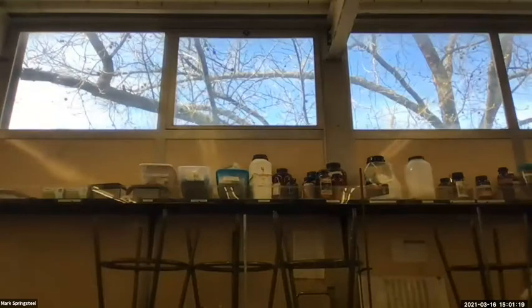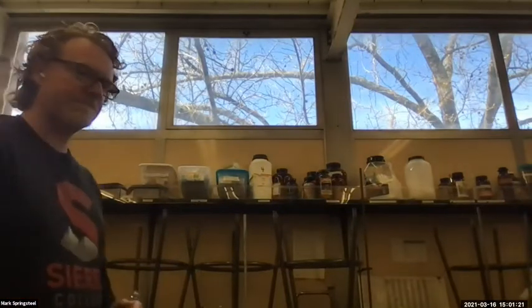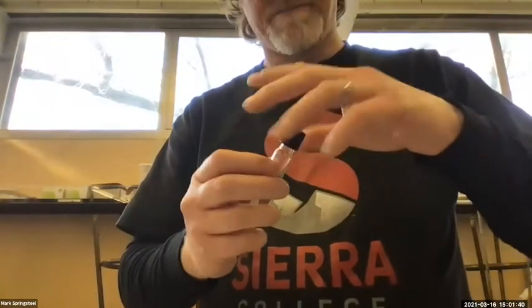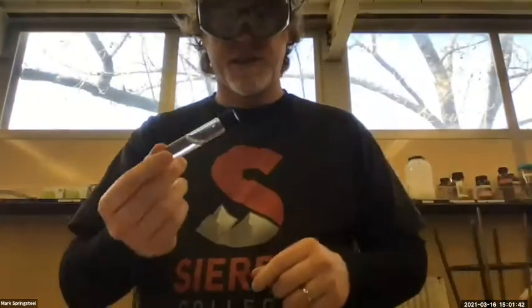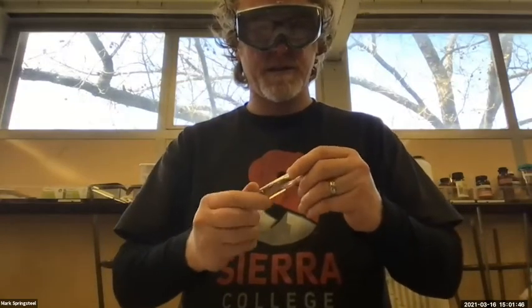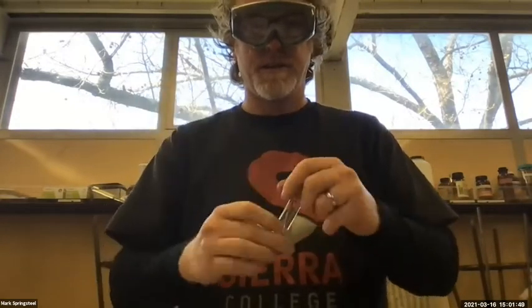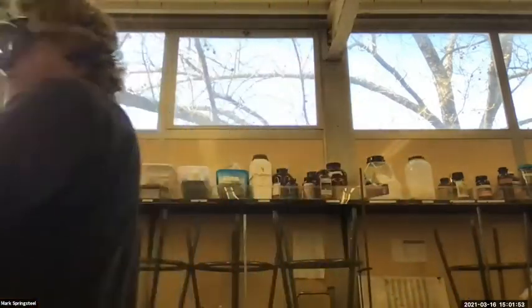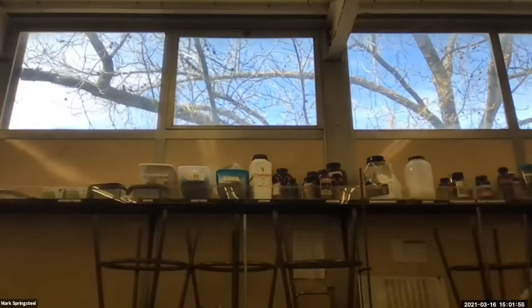So I'm going to add a little water to this. Grab a water bottle. I just went ahead and added a little tap water. So I'm going to cap this and then just start slow, give it a little tilt. Yeah, it looks pretty good. It's not leaking at all, so that's good. This is ready to go. I like it. I'll use this one. Dump the tap water in the sink.